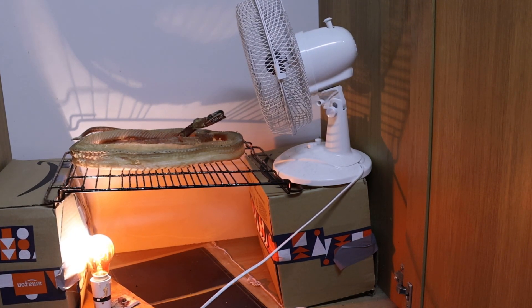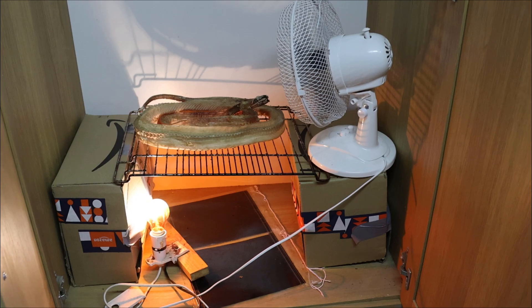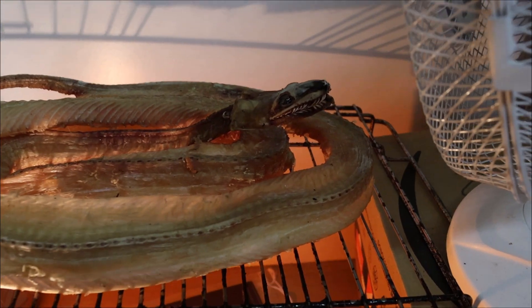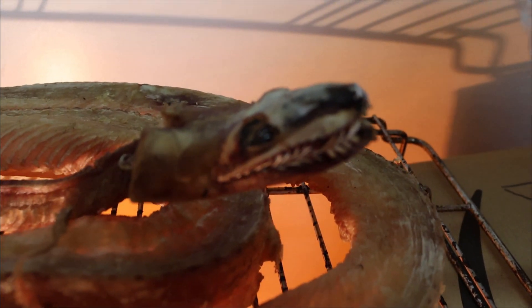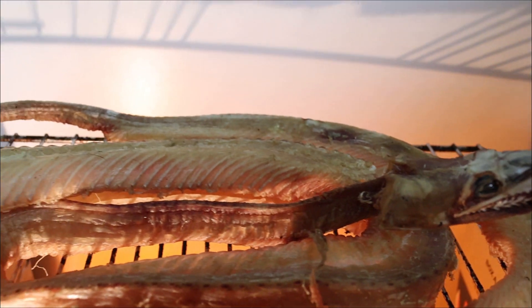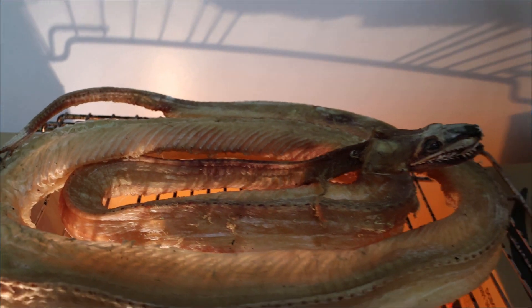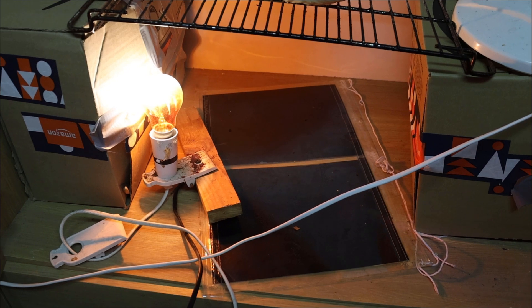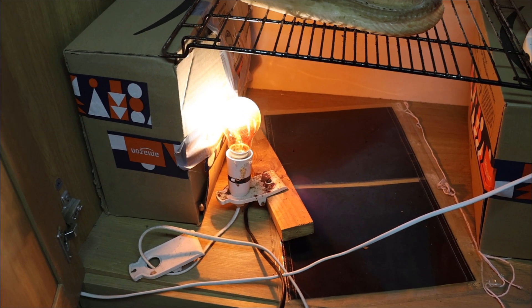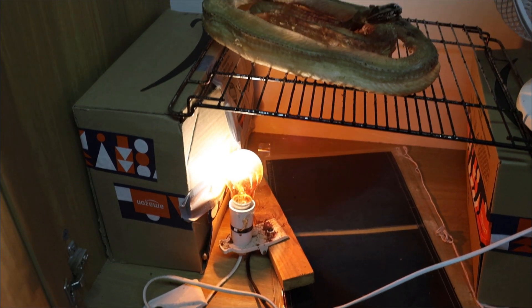I don't think it matters what the temperature of the air is as long as it's warmer than the ambient temperature outside the box and moving. Weather can be a complicating issue here and I do anything of any size in the winter to take advantage of cooler outside temperatures and the absence of flies. Small mammals and birds will dry quickly in any weather in a suitably sized box with a lamp and heat mat, but if I wanted to do anything larger and lived somewhere milder and more humid I think I'd be looking for an alternative technique.